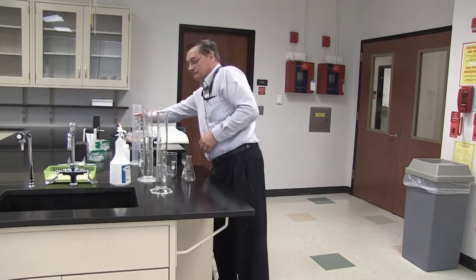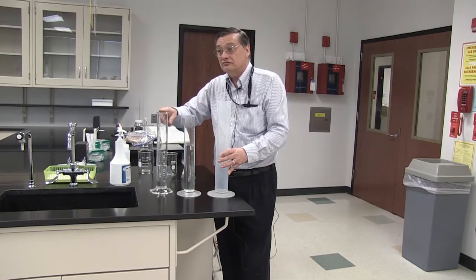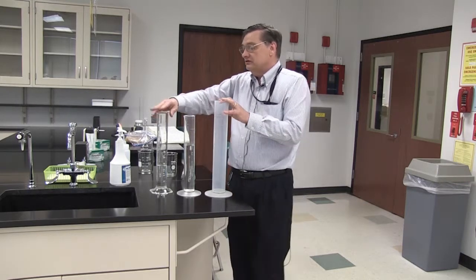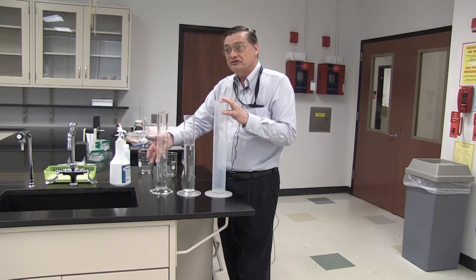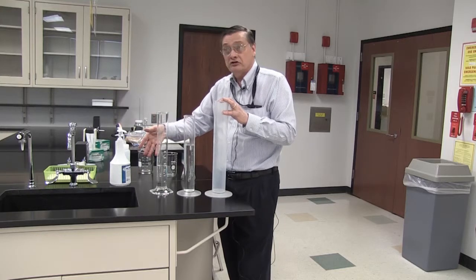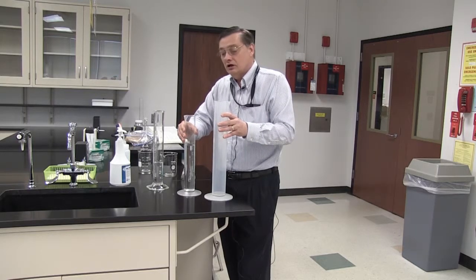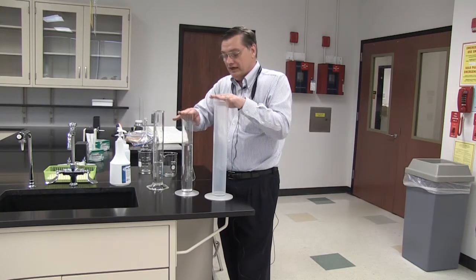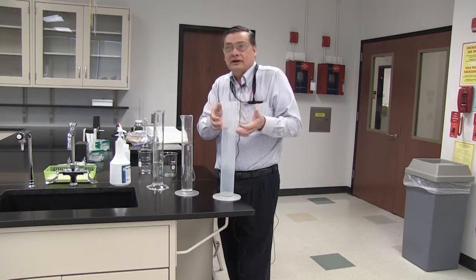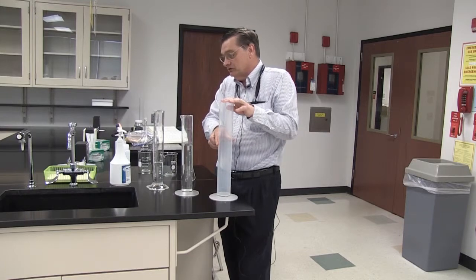I also have three different types of cylinder here. This one being glass, these two are plastic. You can see the advantage of the glass: you can see how clear it is and how much easier it probably is to view the liquid inside. The disadvantage is if I knock it over, it's going to be toast. You know, it's gone. The plastic ones are much more durable for lab use. They have good accuracy. You can see this one is very durable, but it's a kind of cloudy plastic, which would make it more difficult to read the volumes on some liquids.